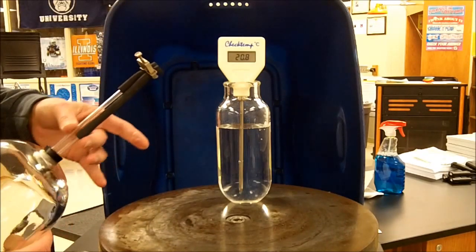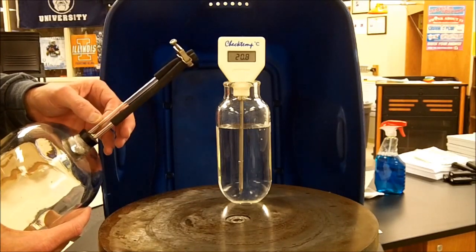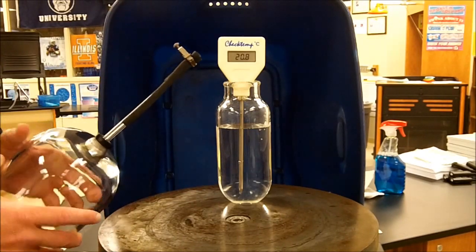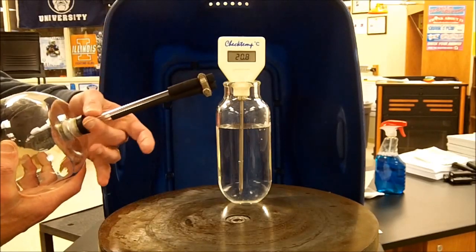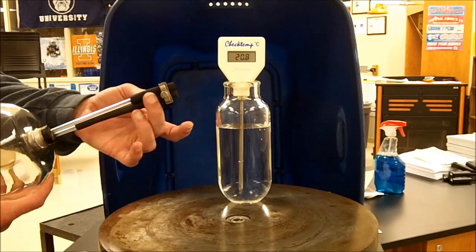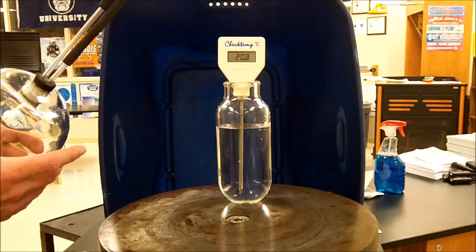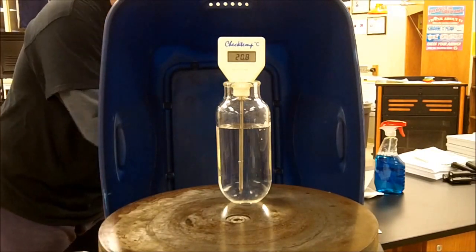Then I also have two glass rods here. Not rods. I'm sorry. They're not straws, but they're kind of like straws, but they're open rods. And I have to have a device here to allow the air to come back in once the experiment's finished. So let me put some petroleum jelly on the bottom of this jar.